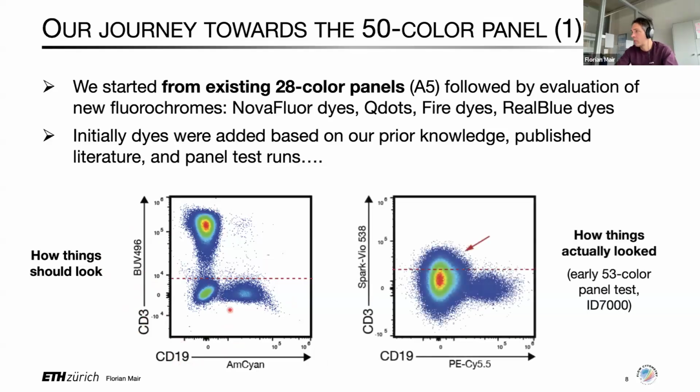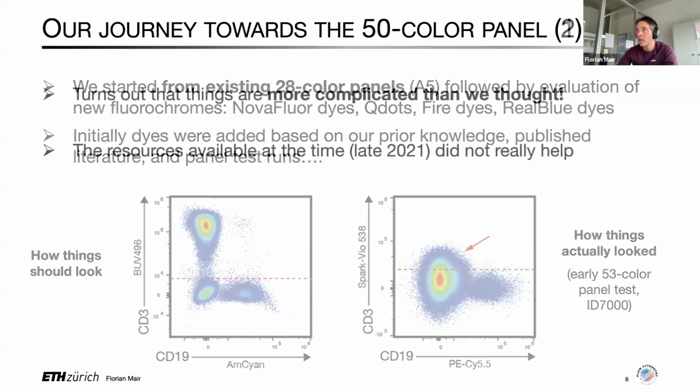And that's how it looked like when we did our very first panel test. That was, I believe, the very first 53 color panel test that we ran back then on the ID7000, where clearly things didn't work very well, which either means we didn't know what we were doing or it was actually more complicated than we thought. Luckily, I think it was in the end more complicated than we thought.